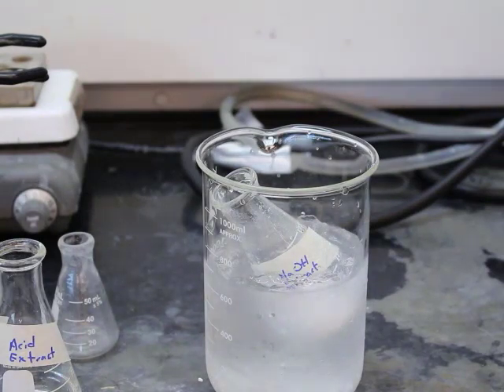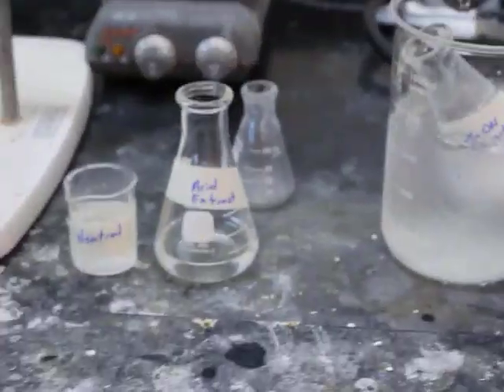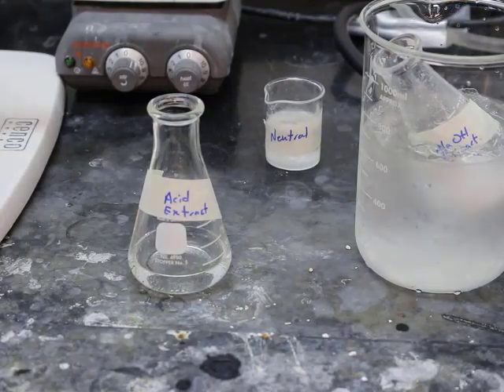And so that nice pink, fuchsia, magenta, not very great with color names, but anyway, you can tell it's sort of a reddish pink color. It did pH test acidic. And then the fact that we see all of that white powder in there tells us that we did have a solid, something did get extracted into it. And so all that white powder should be our acid that was removed from unknown A.